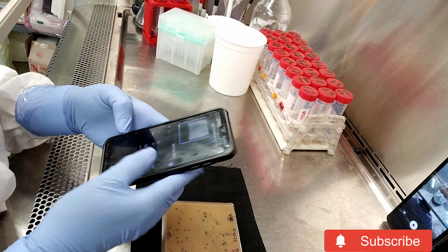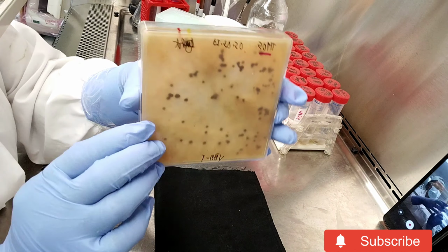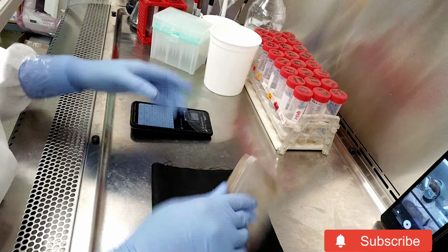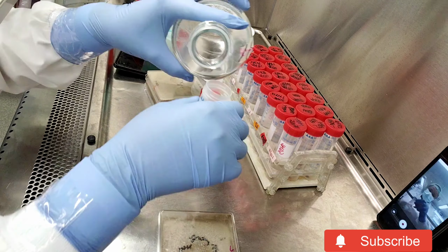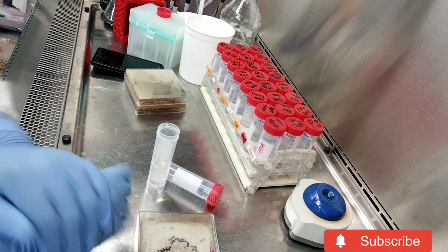Some of the plates you can see that they have different colors, and it's just that the different pathogens produce different colors for different reasons. Some of the darkness or the pigmentation helps them to infect. After I've collected images, I move in cycles. So if I'm doing light, I do light first. If I'm doing A, I do A first.